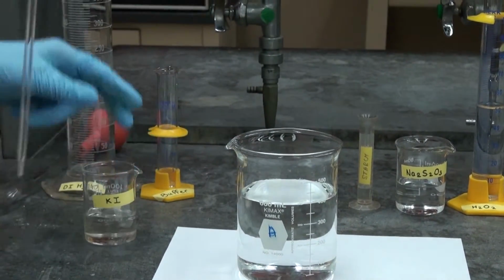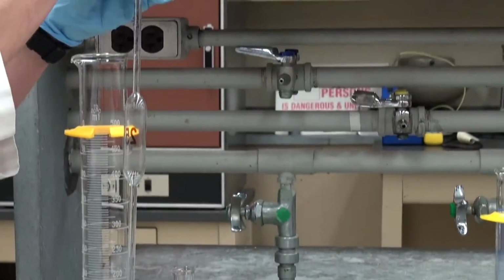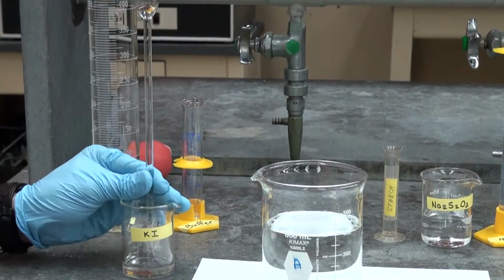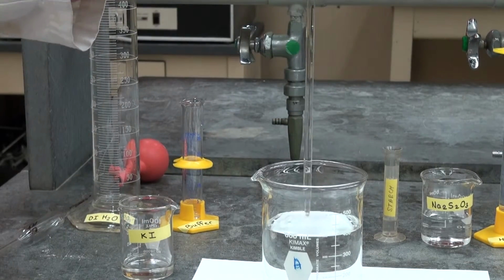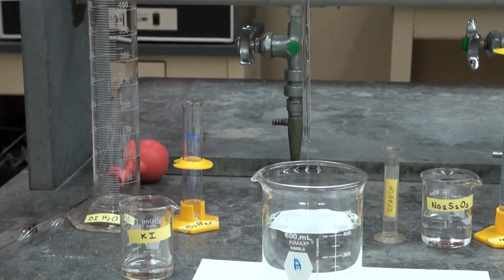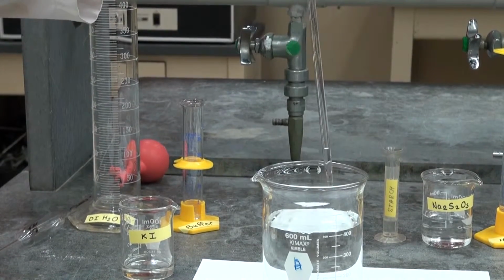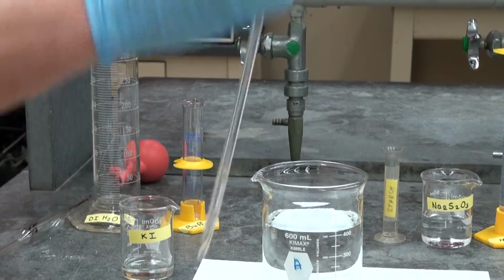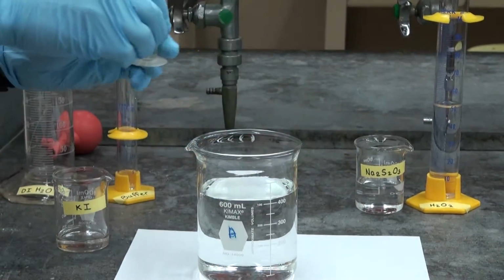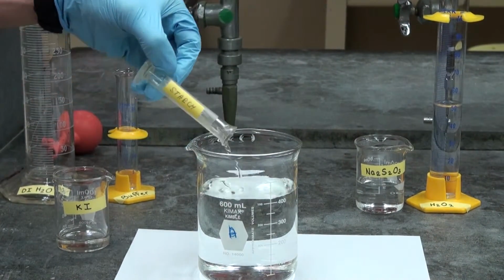So for this addition we will use a 25 milliliter pipette, which is drawn into the glass through the use of a pipette bulb. We then add that to the mixture. Be sure to touch the tip of the pipette to the side of the glass to get all of the material into the mixture. Next we can add the starch, which also does not need to be known all that accurately. A simple graduated cylinder will work.